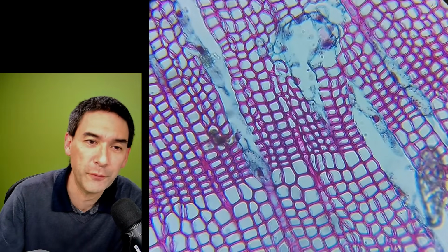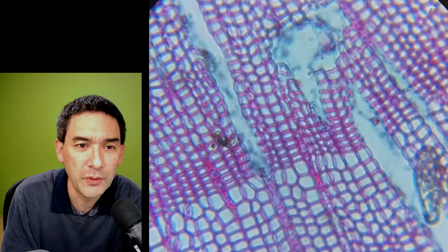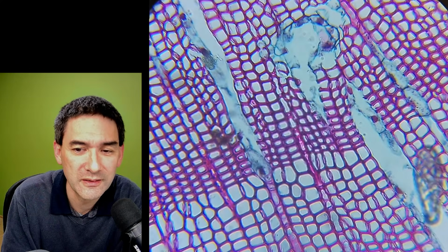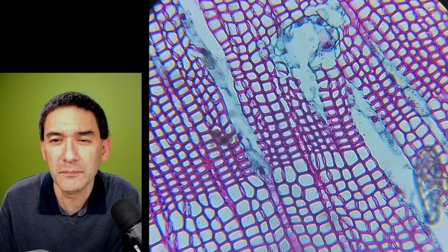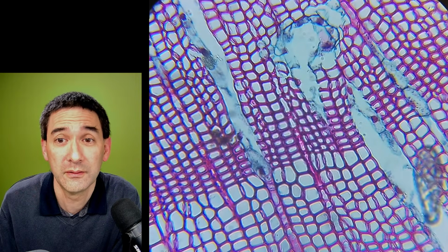So this is not a 40 times. It's actually the maximum magnification that I'm able to get here. If I refocus again, then you see the camera itself will also attempt to find the focus. Yeah. So let me quickly have a look. Yeah, there are a couple of comments here. What would you like to show under the microscope on your channel that we haven't seen on your channel before? I'm asking you that. Okay.